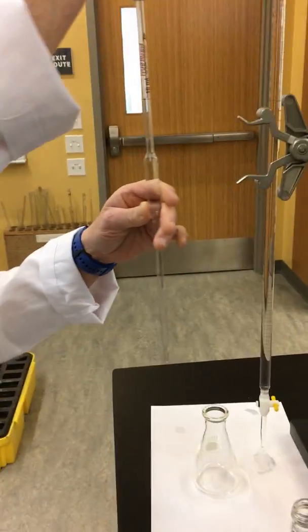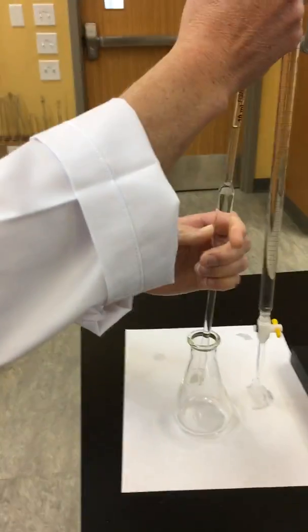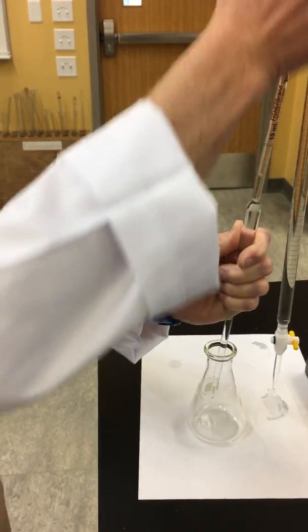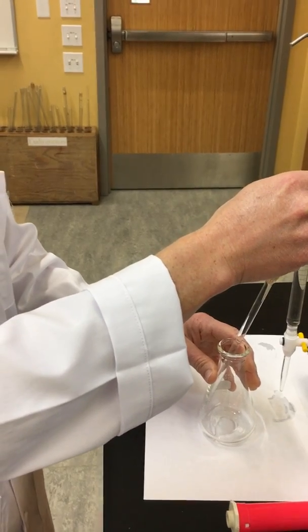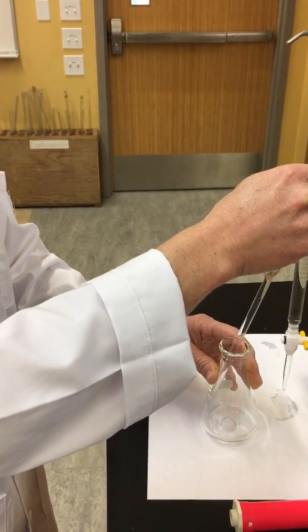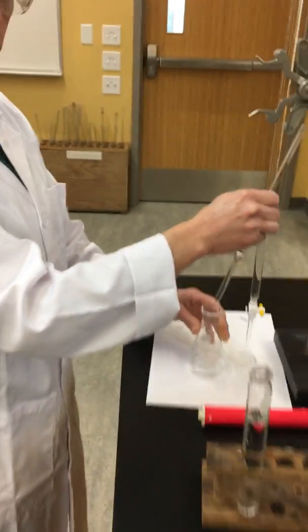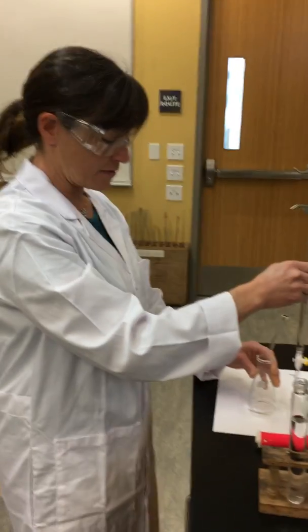We're right at the line. We're transferring 10.00 milliliters of hydrochloric acid solution into our Erlenmeyer flask.